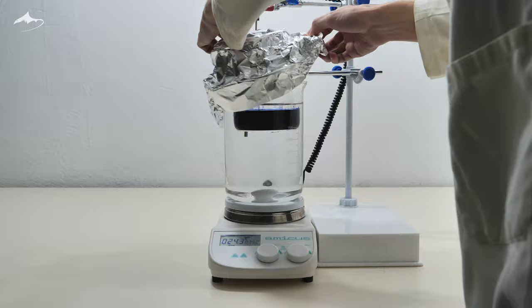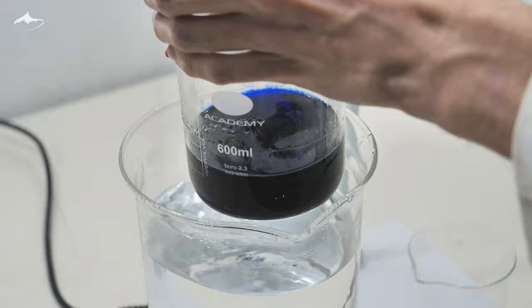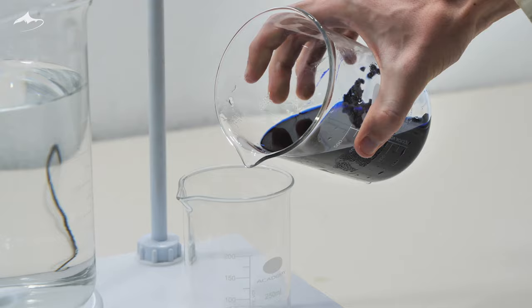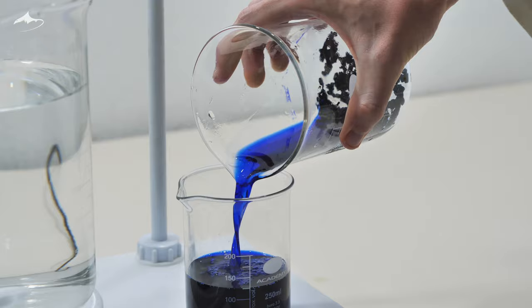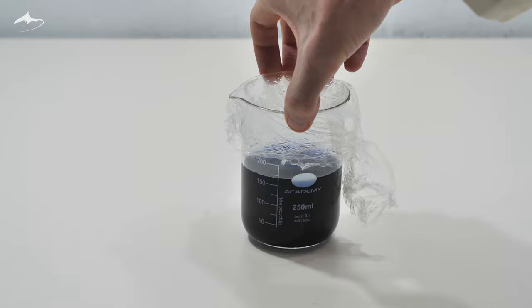After two days it was time to see what was obtained. The stirring was turned off and all of the covering was taken apart. The solution was still pretty dark so it seemed as though nothing happened. But here's the moment of truth. So trying not to shake the beaker too much, it was removed from the water bath and the solution was decanted into another beaker. And there they are, beautiful large crystals of tetramine copper sulfate monohydrate.